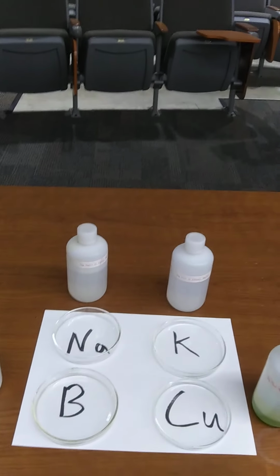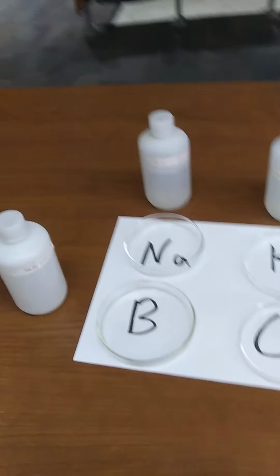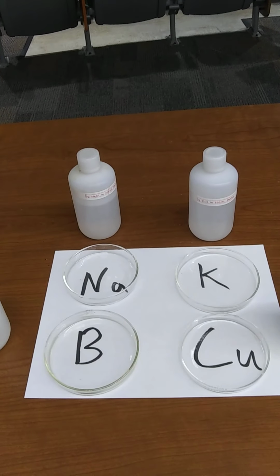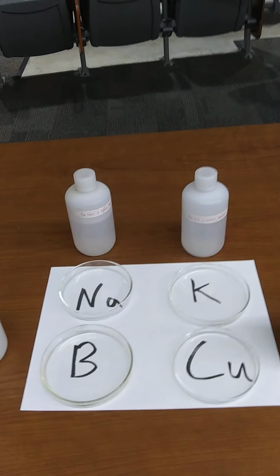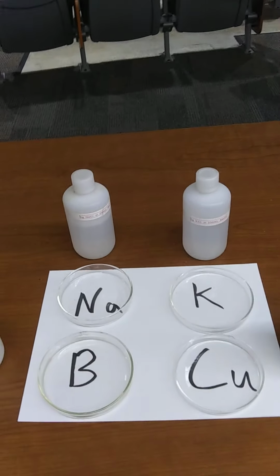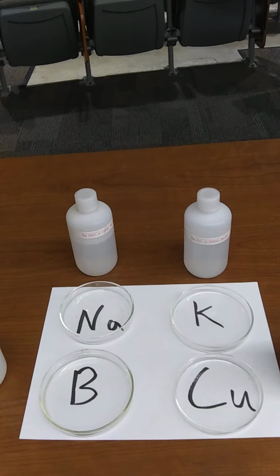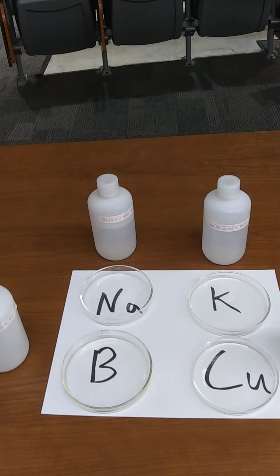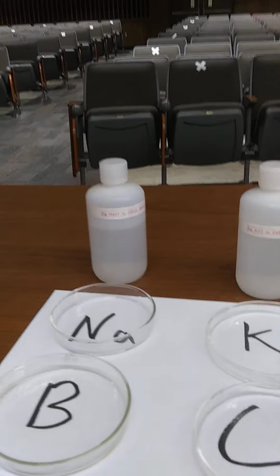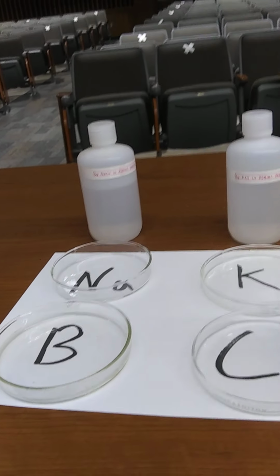It's sodium chloride, potassium chloride, copper chloride, and then boron is boric acid. And it doesn't actually matter what the solutions are. Once this goes, if you've watched the previous, there's going to be 2 demos here. Once it's heated up, it's actually the gas phase atoms that are involved, and that's what we're going to see. So I'm going to see whether I can do this or not, and then I'll have to go turn off the light. So just going to pour in the solutions.